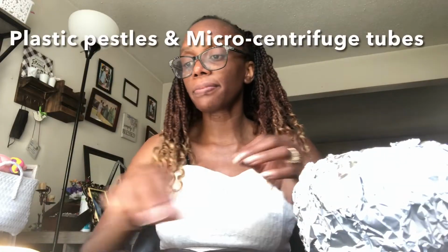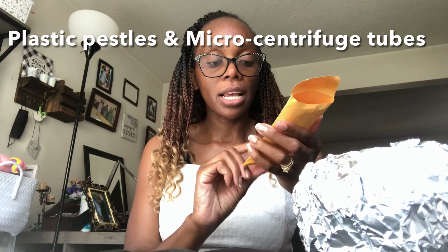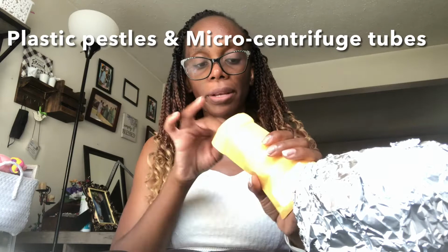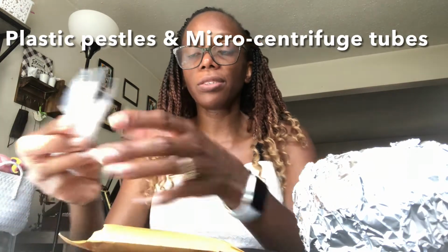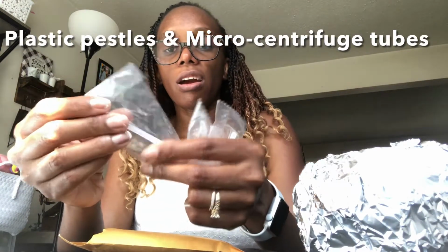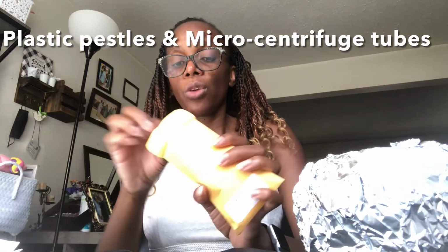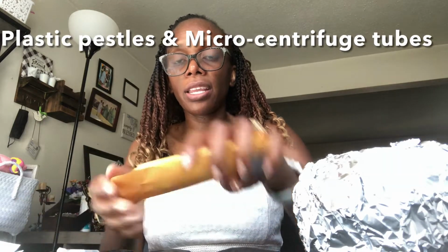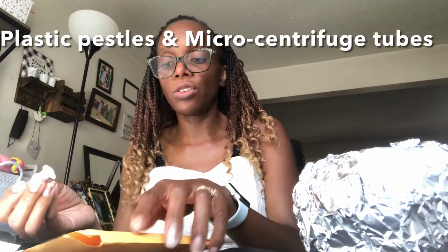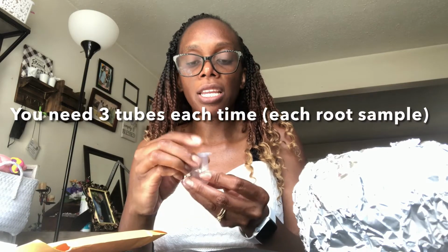Then you have your envelope in the lab kit that says microcentrifuge tubes and plastic pestles. These are the plastic pestles. They are individually wrapped, so they're kept sterile. You will need one for each location, each pot. And then you have the microcentrifuge tubes. You should have 5 or 6, 5. To start with, you just need 3.